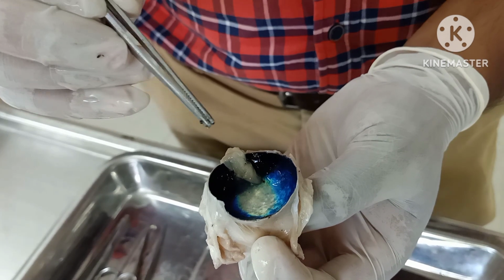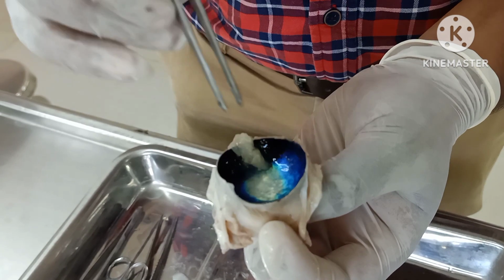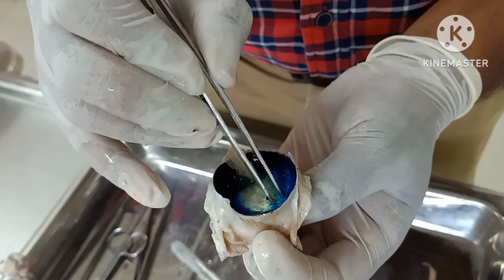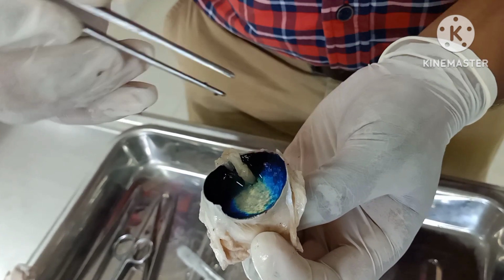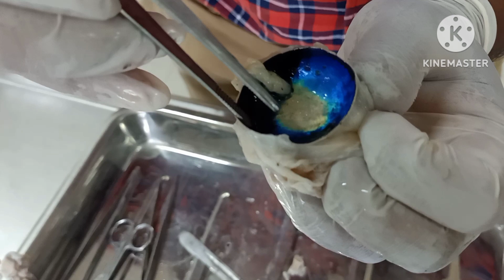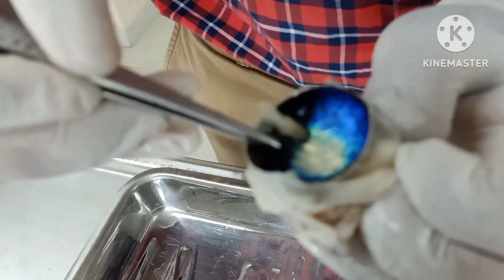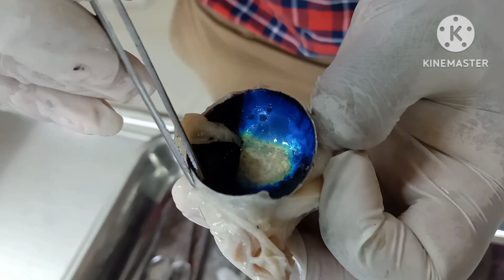That is the reason when you focus light in the eyes of an animal during night, you can see a greenish or bluish colored structure. That is because of the tapetum lucidum, the specialized cells which reflect the light, present along with the choroid. This completely blackish layer which you are seeing here is called the choroid. This is the vascular layer. When you reflect this choroid, you can see one more layer which is a little thicker.